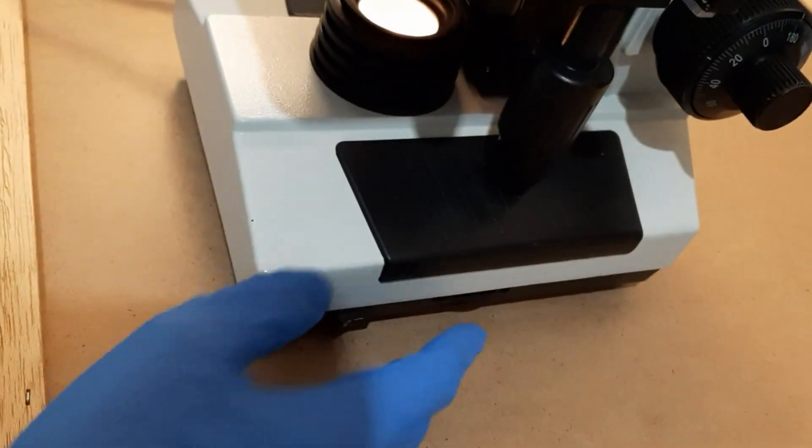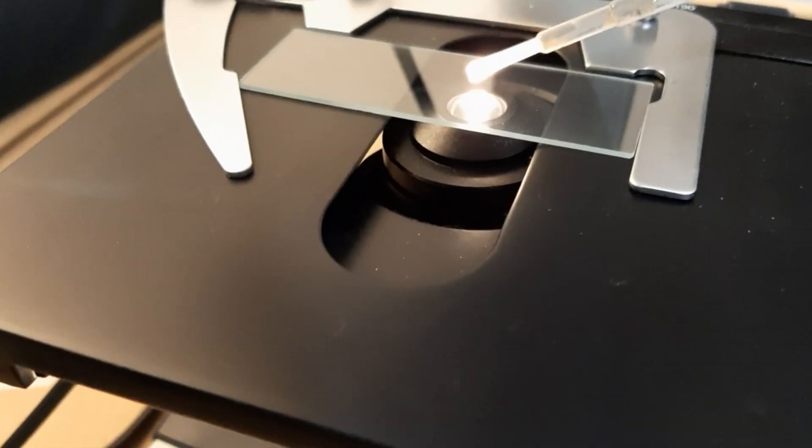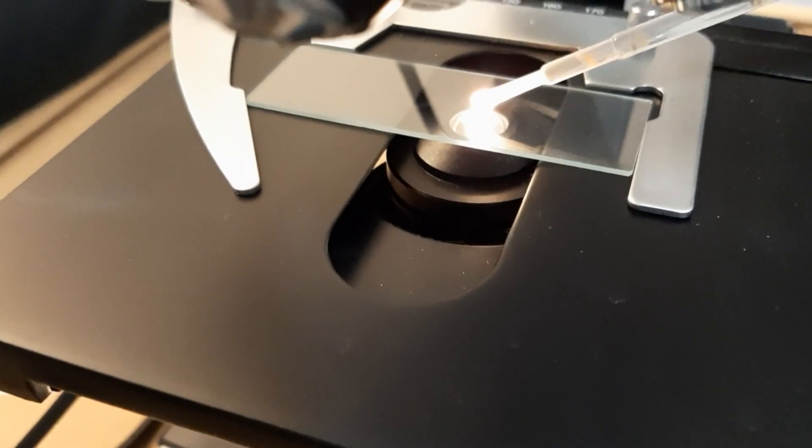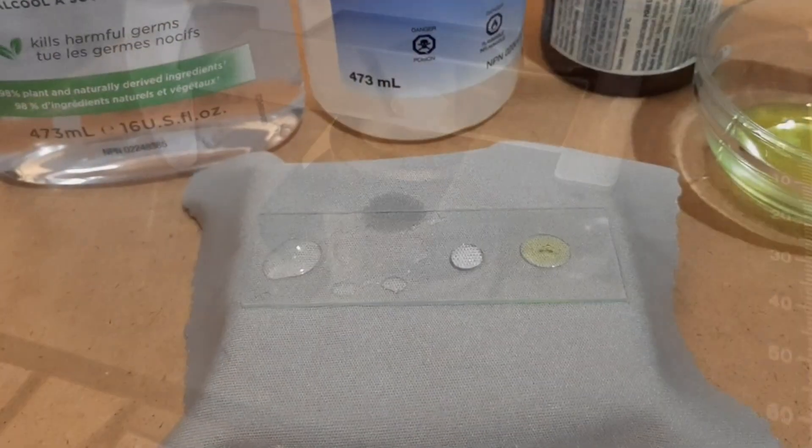Ever wonder how well antiseptics really work? To demonstrate, we will expose four antiseptic materials to microbial colonies and observe how they respond.